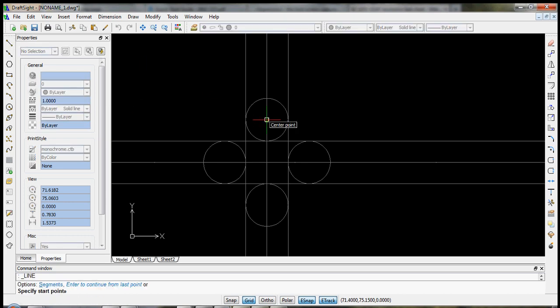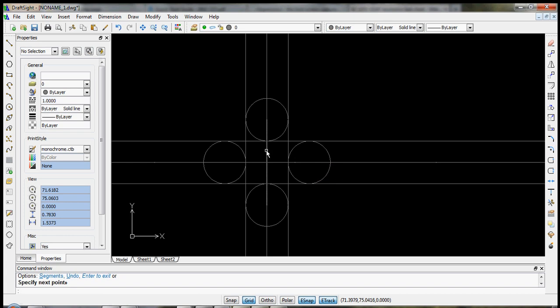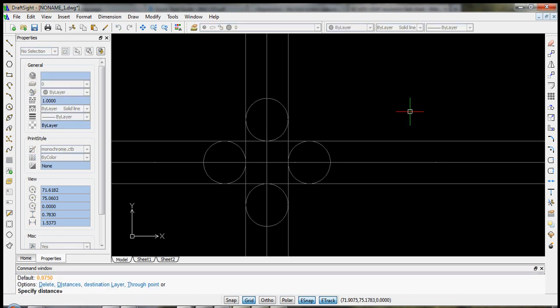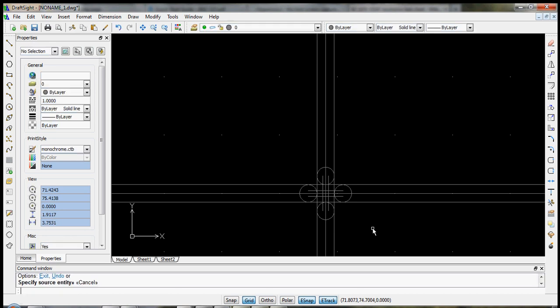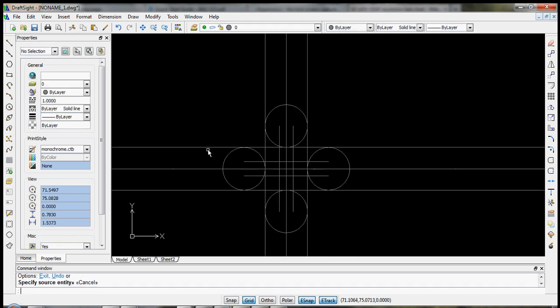Now let's make some new lines in the center of each of these. And again, we're going to take these and offset them. This time we're going to offset them to make a 50 micron wide channel, so half of that is 0.025. We'll select our first line and do both sides, horizontal line on both sides. Okay, so this now has all the shapes we want, but it's kind of a mess. So we need to start deleting some lines.